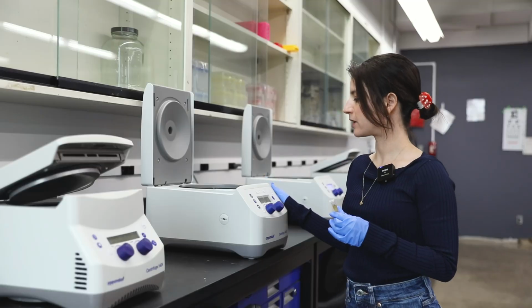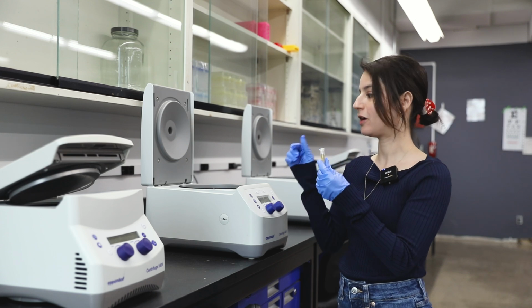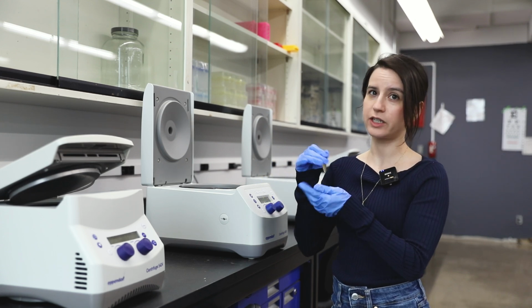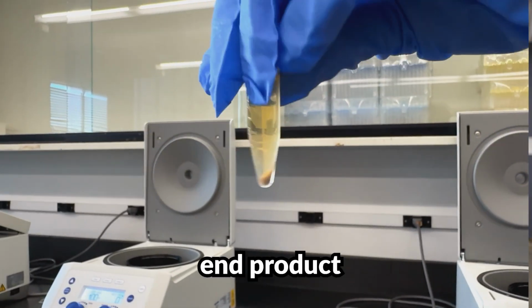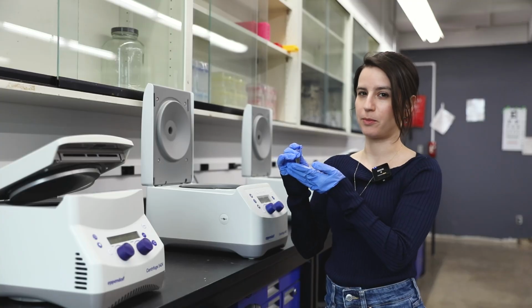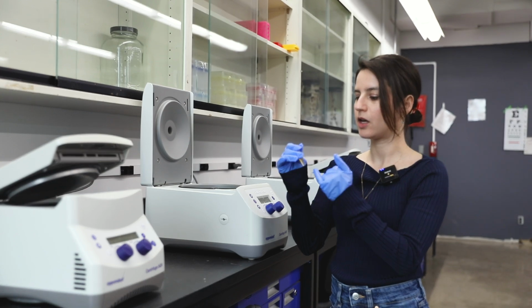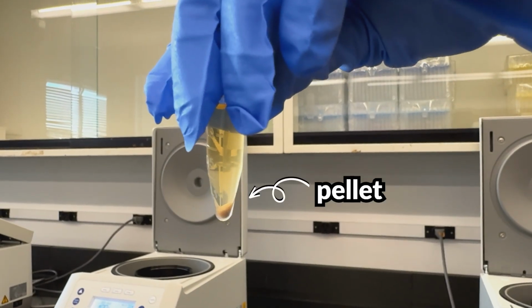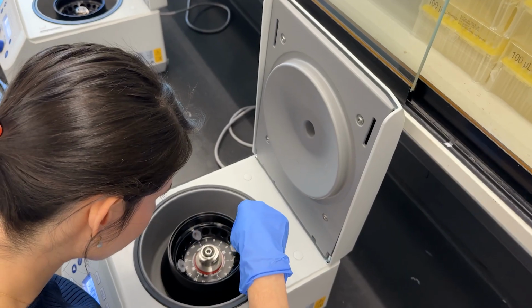This is a benchtop centrifuge, and it's used to spin tubes like this that have our mixture of kombucha really, really quickly. The purpose of centrifugation is to essentially separate a liquid into the solids, which will fall to the bottom, and then the liquids that will rise to the top. In our case, kombucha is made up of a bunch of different things, including microbes, tea, which is the liquid. So through the centrifugation, the microbes will form a pellet at the bottom, and then the rest will be the liquid layer on top.